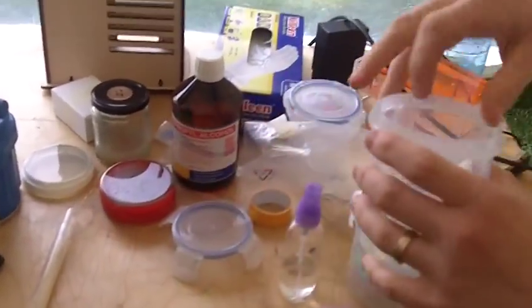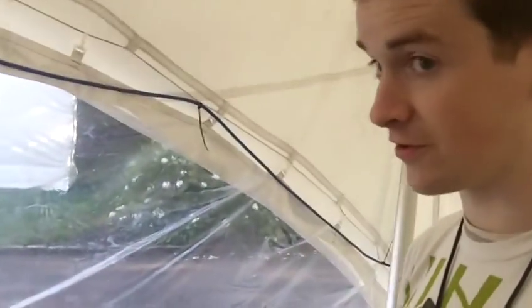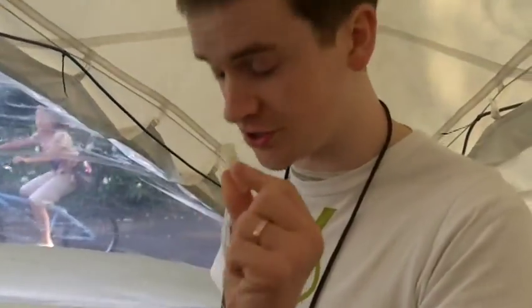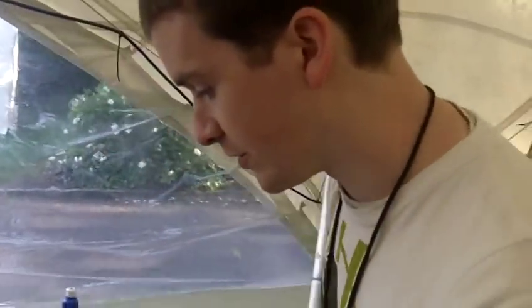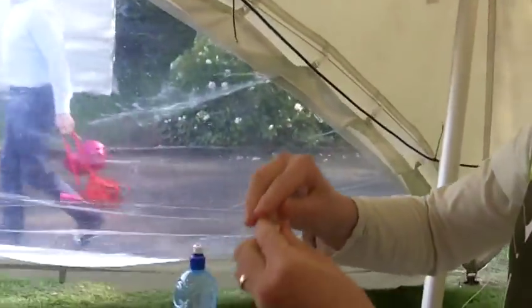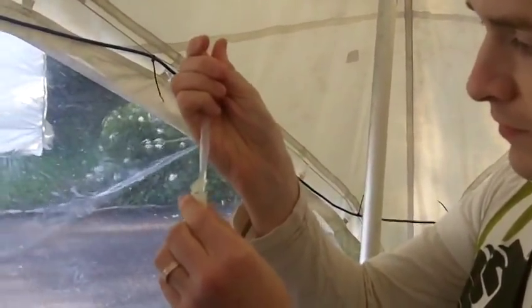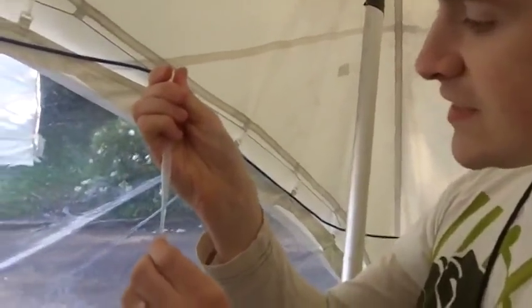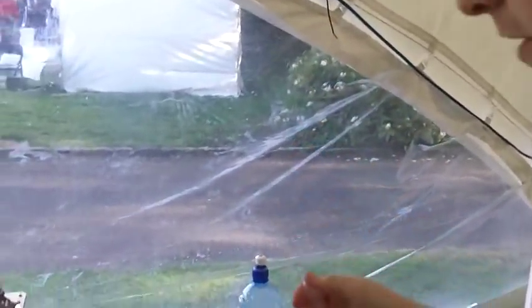I'm using a highly purified form of dishwater detergent called sodium laureth sulfate. Please look in the ingredients and you'll see that on almost everything in your house — shampoo and so on. I happen to have pure sodium laureth sulfate. You only need a drop. What it does is: cells are surrounded, for the most part, by a membrane of fatty lipids, and by adding a detergent you break those open and release the DNA inside.